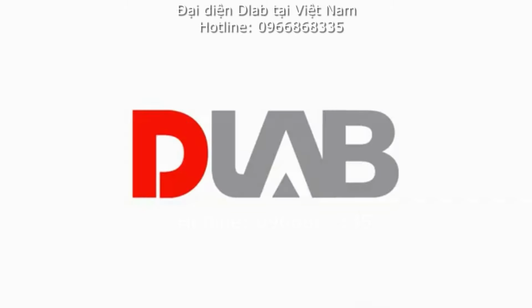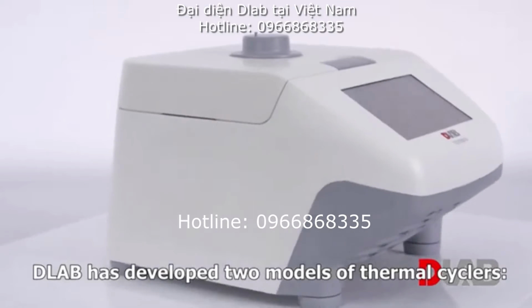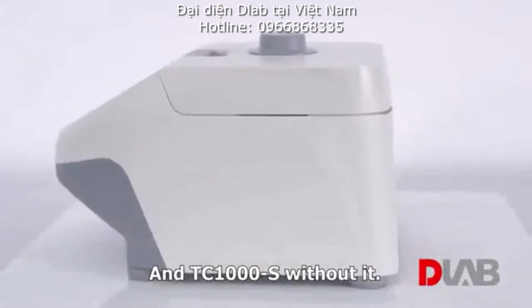PCR thermal cycler. Dlab has developed two models of thermal cyclers, TC1000G with gradient control, and TC1000S without it.